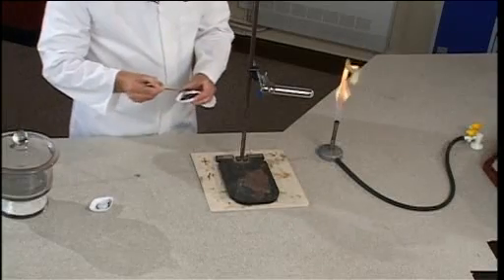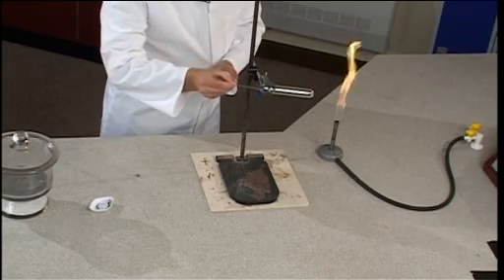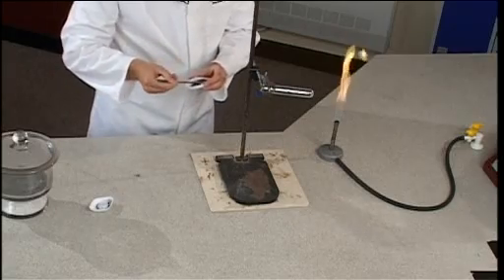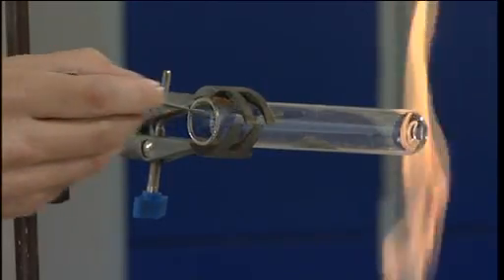Use a spatula to place the mixture inside a Pyrex tube. It's essential that it is a Pyrex tube because the heat of reaction will be so intense that the tube will eventually melt.